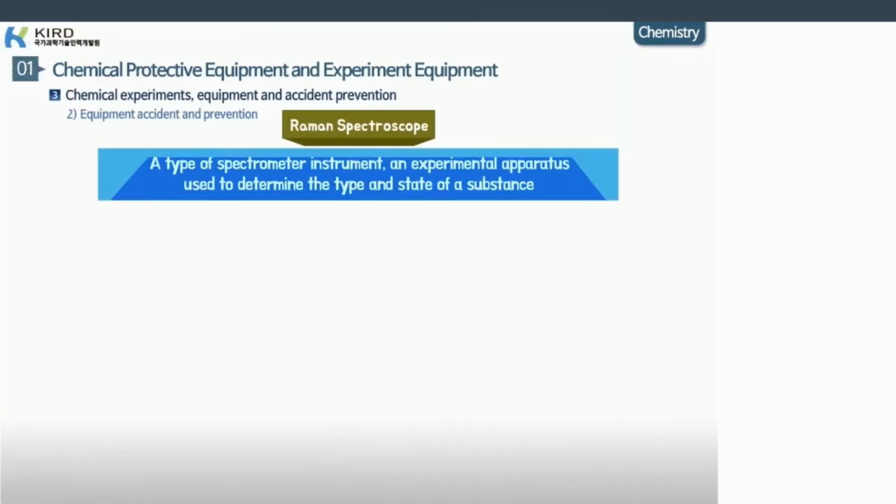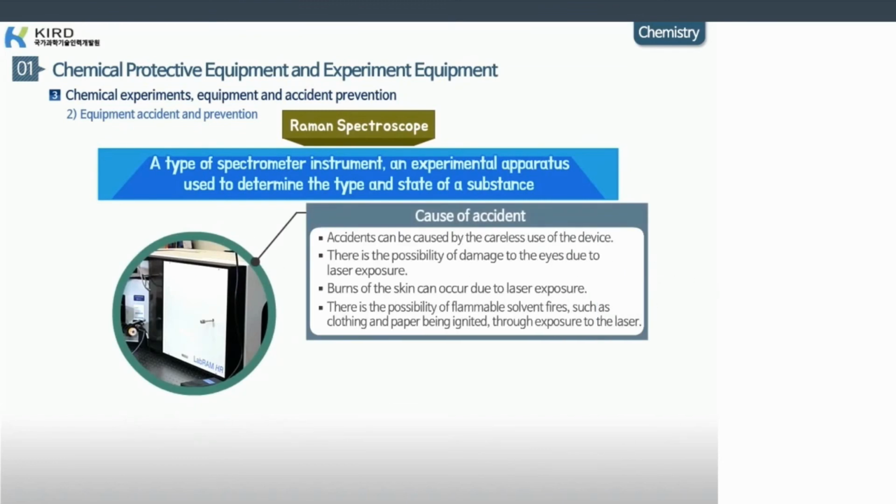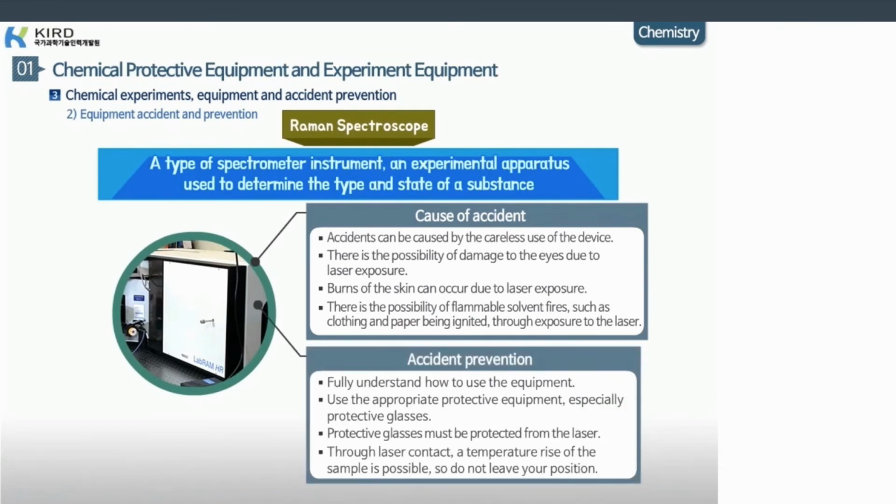The Raman spectroscope is a type of spectrometer instrument, an experimental apparatus used to determine the type and state of a substance. Accidents can be caused by the careless use of the device. There is the possibility of damage to the eyes due to laser exposure and burns of the skin due to laser exposure. There is also the possibility of inflammable solvent fires, such as clothing and paper being ignited through laser exposure. To prevent an accident, fully understand how to use the equipment.